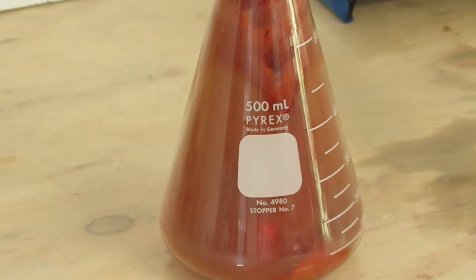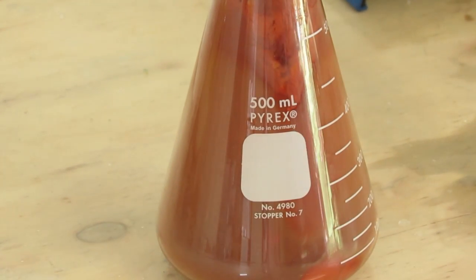As you can see, a lot of heat is produced in this reaction. If you feel the side of the flask after the reaction is over, it is very hot.